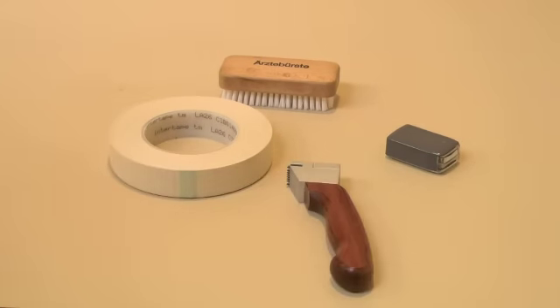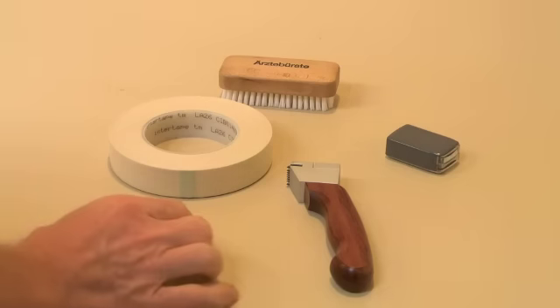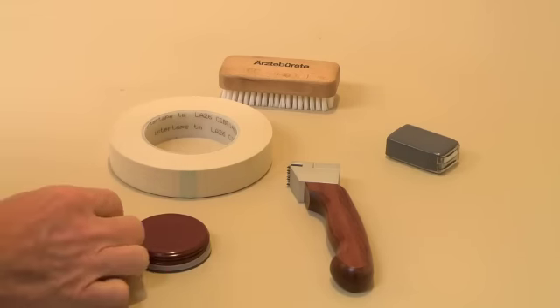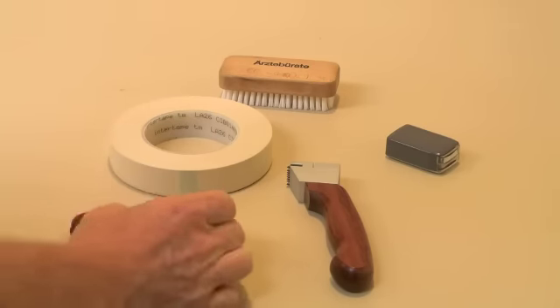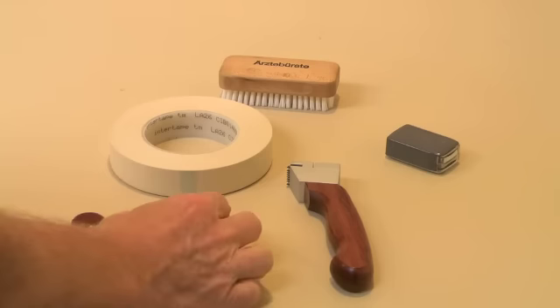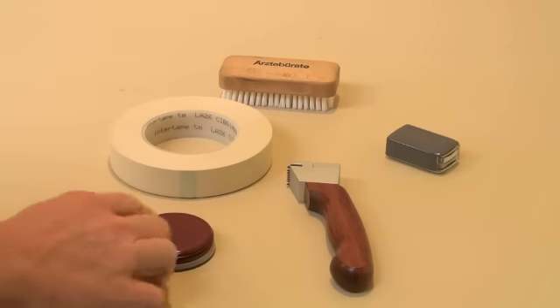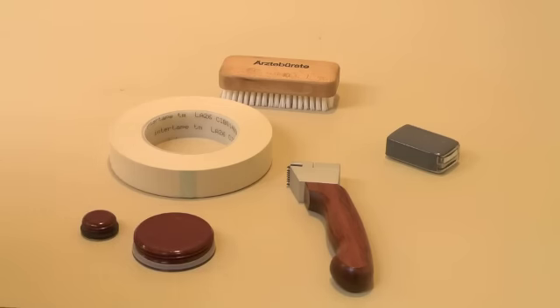In addition, we will demonstrate how to do crosscut tests on some unusual samples. The samples we will be measuring today are drum plugs for 55 gallon drums. These are coated and we want to determine whether the coating is adhering properly to these drum plugs.